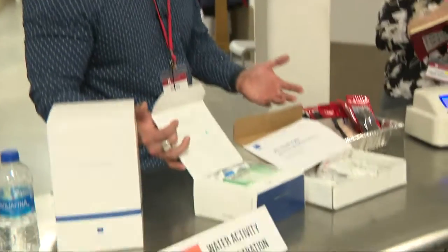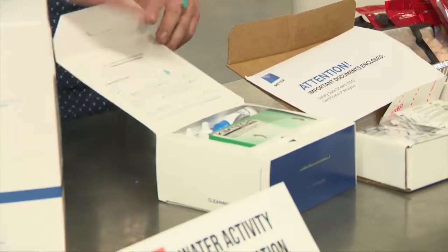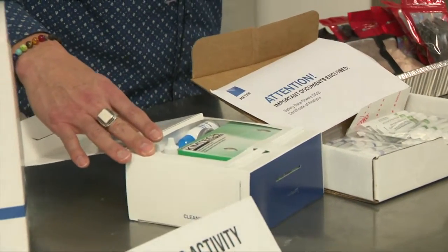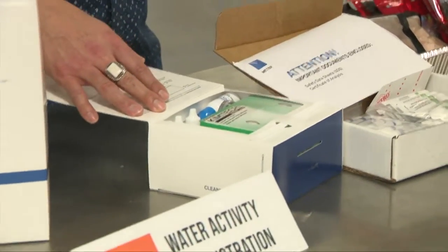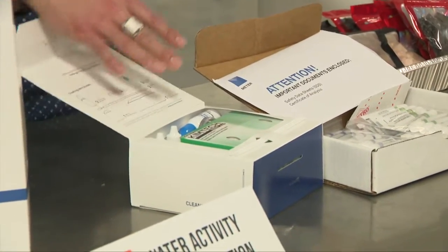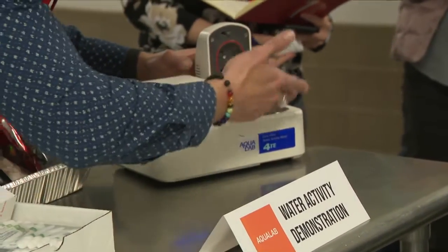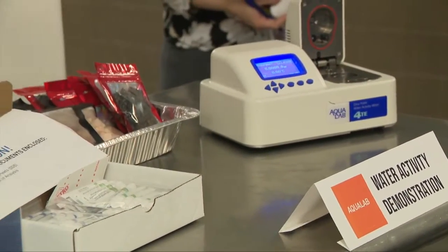Here's a cleaning kit for it. It's really important to stay on top of cleaning these devices. Basically it's a three-step method: clean with isopropyl alcohol or the included cleaning solution, then clean with distilled water, then a dry Kimwipe. Just be careful around the fan and take your time. You want to clean it every shift, or set a protocol for how often you stay on top of cleaning.